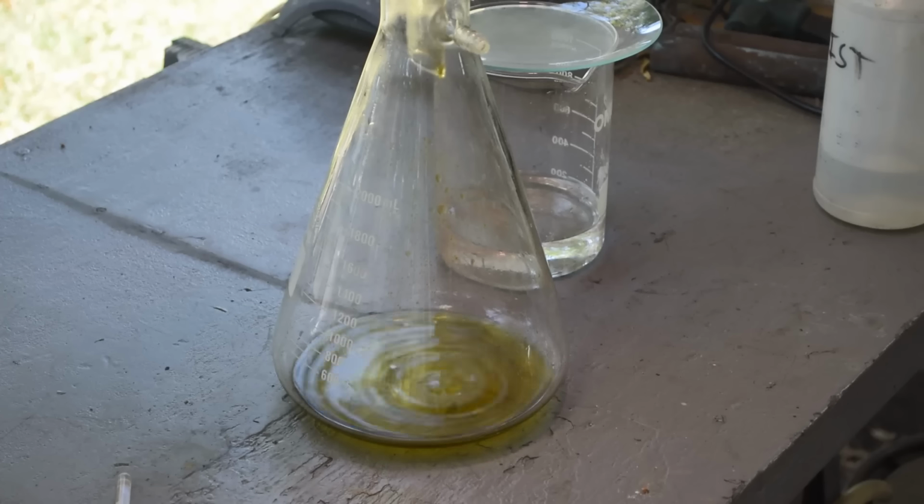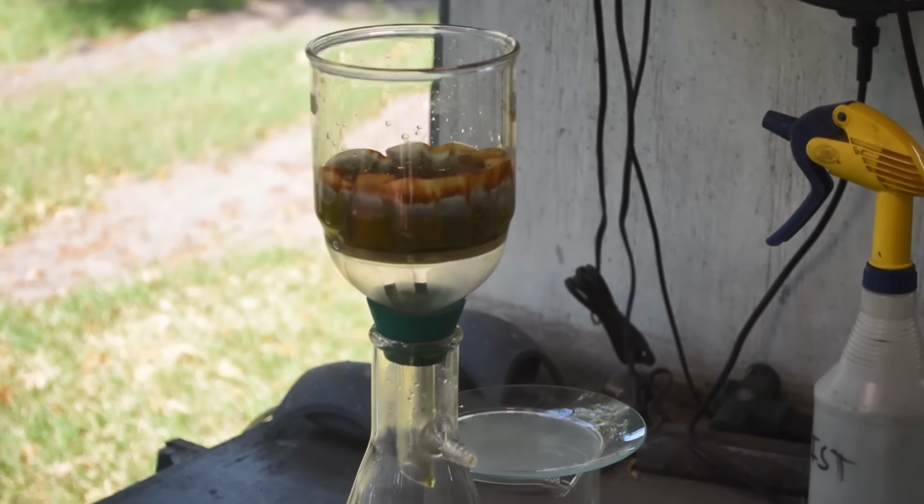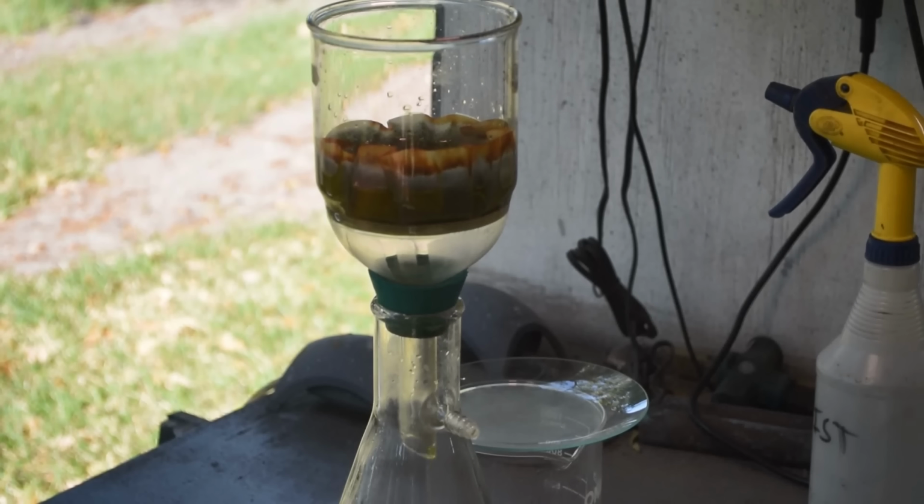Yeah, it's really coming through green now. I suspect that would be copper chloride we're seeing coming through there. So that's good. We're getting the base metals out of the mud up here at the top. And should be left with nothing but gold in the end.